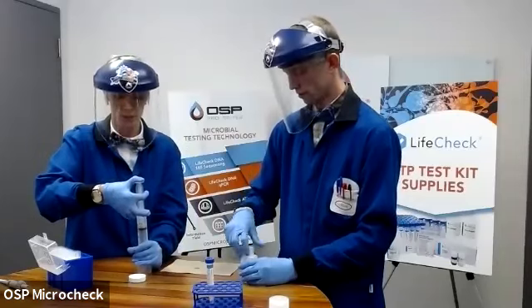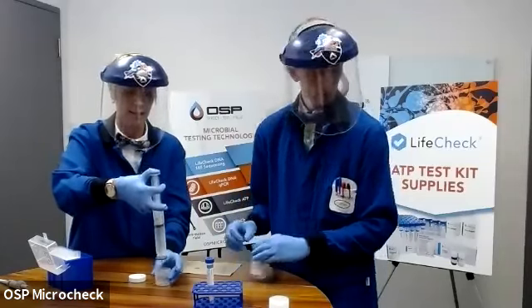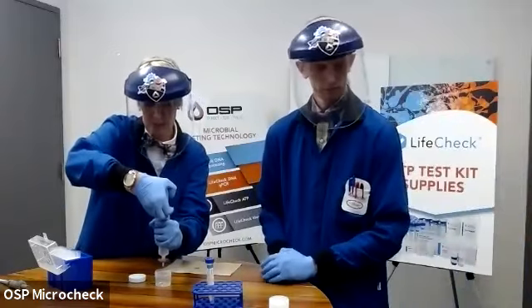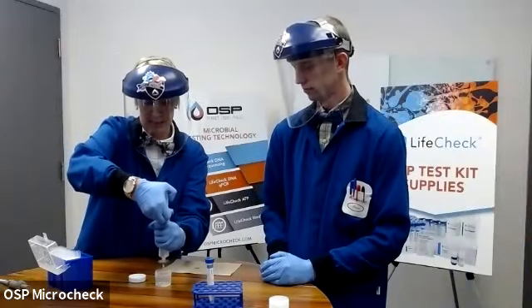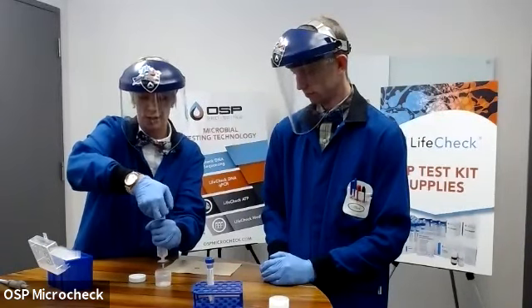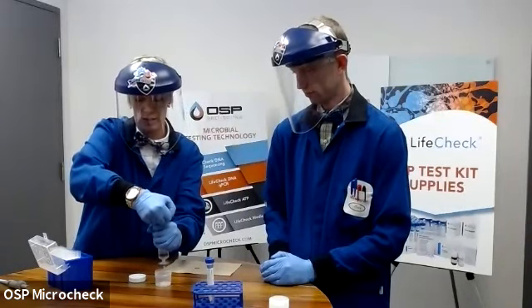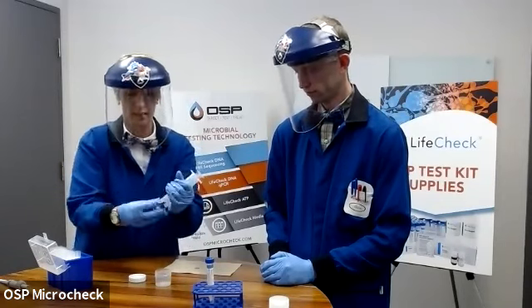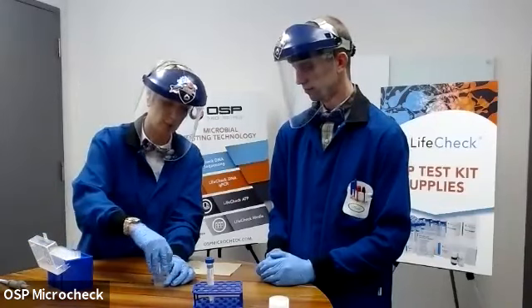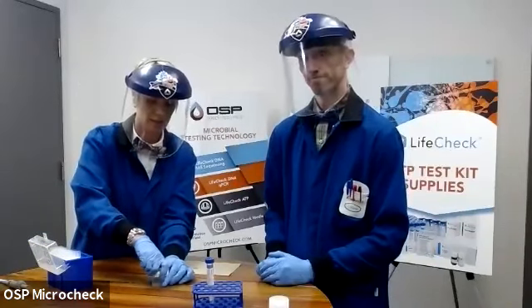All right, this one you want to push all of that fluid and the air through to the end. So you're going to see often some foaming that comes through. This is a tough one. Look at that. And that's okay. Push this plunger all the way to the bottom if you can get it through. Make sure you get every last drop. And now you're finished with this. And we have our sample captured in the field container.